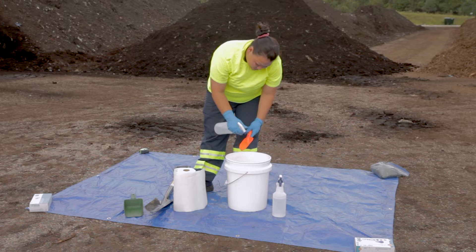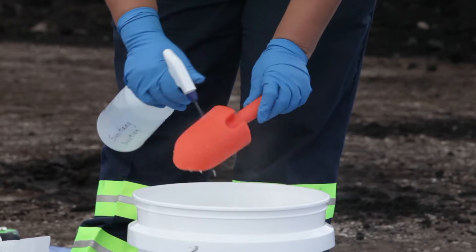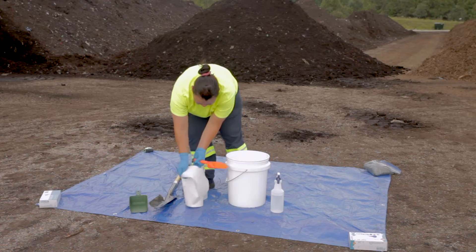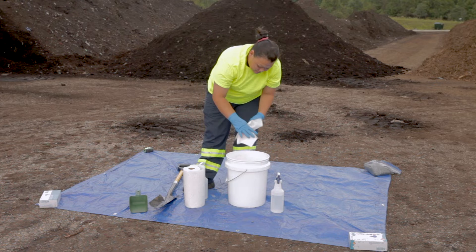It is important that all equipment that will come into contact with the compost during sampling is cleaned and sanitized prior to sampling.